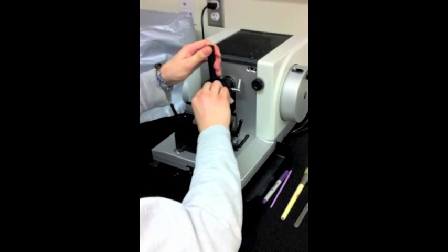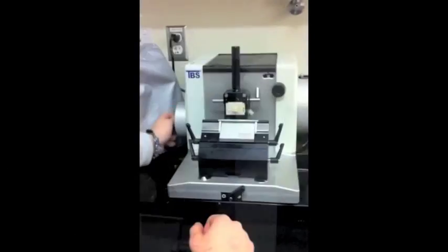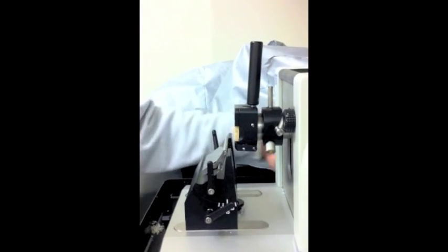Place the cartridge in the microtome by pulling the handle toward you. Use the knob on the right to adjust the thickness of your sections to 10 microns. Adjust the stage with the wheel on your left so that it is close to the blade.